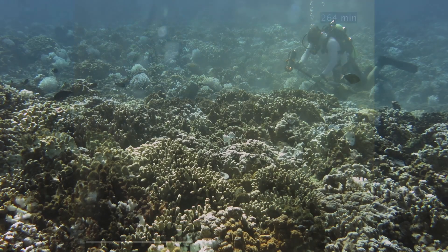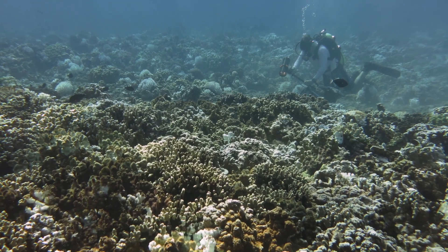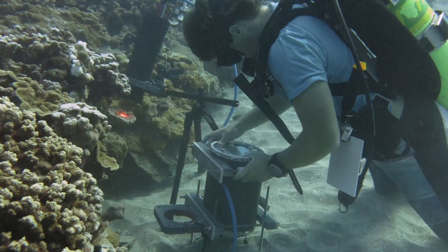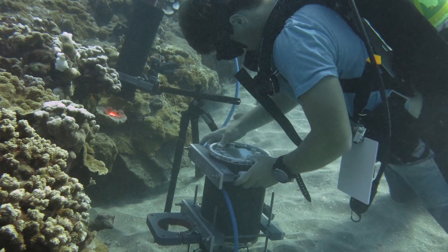People have studied this at large scales in the field and potentially small scales in the lab, but no one has been able to look at these small scales in the field before.